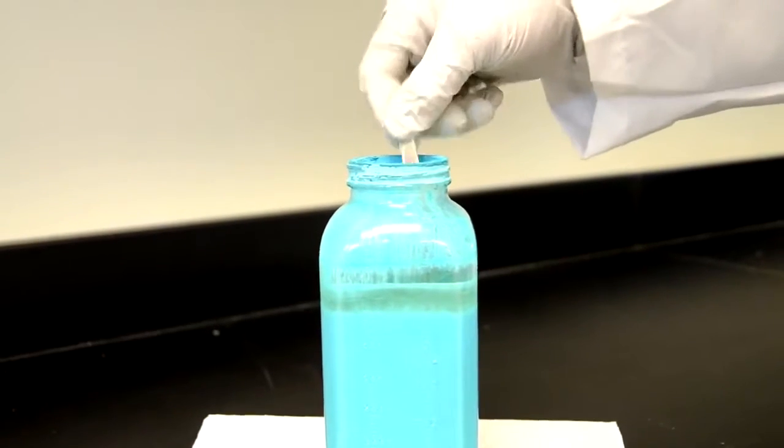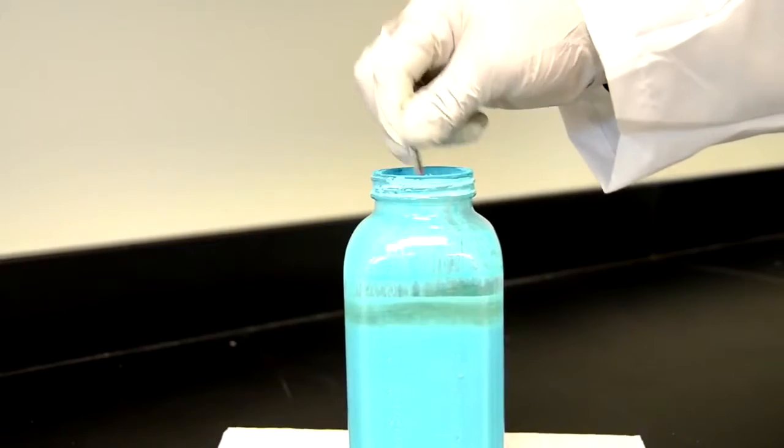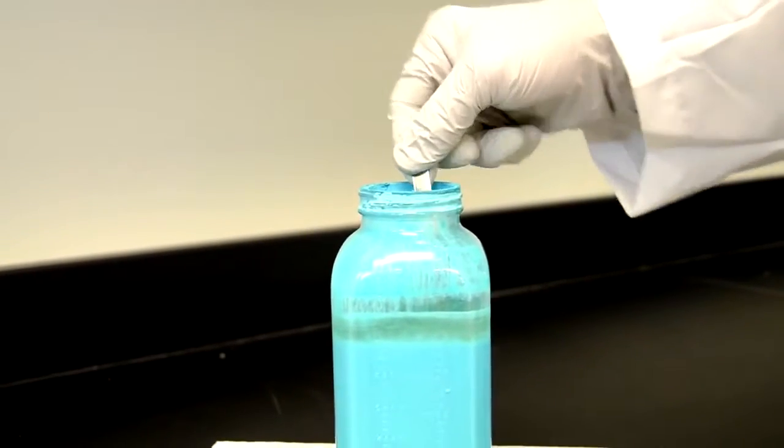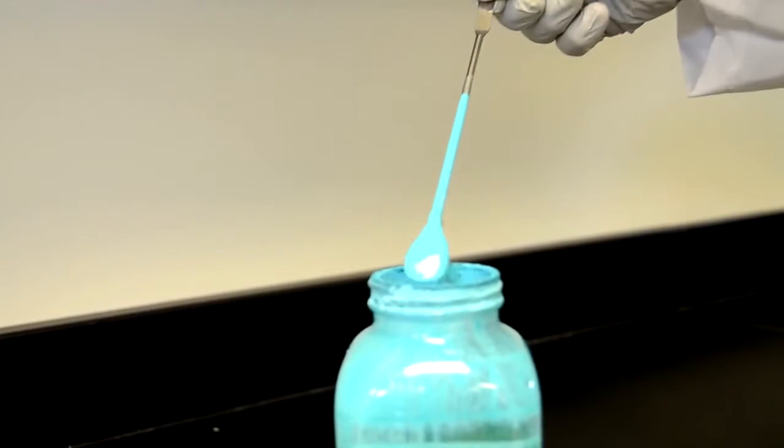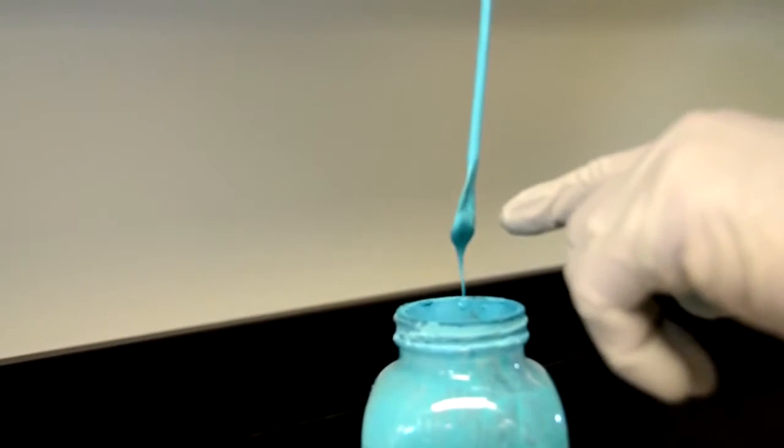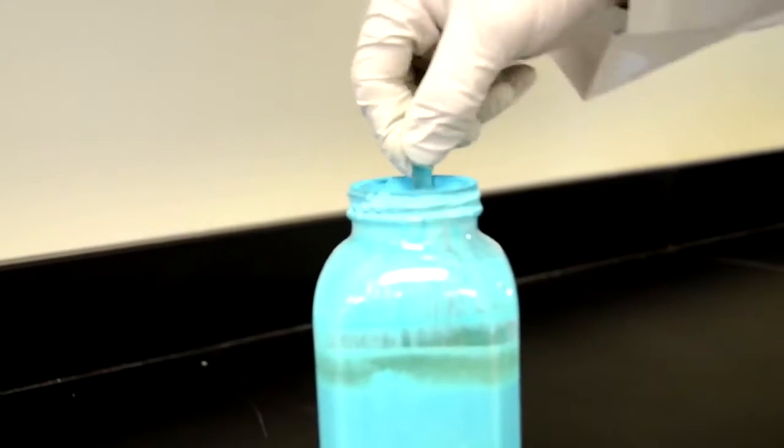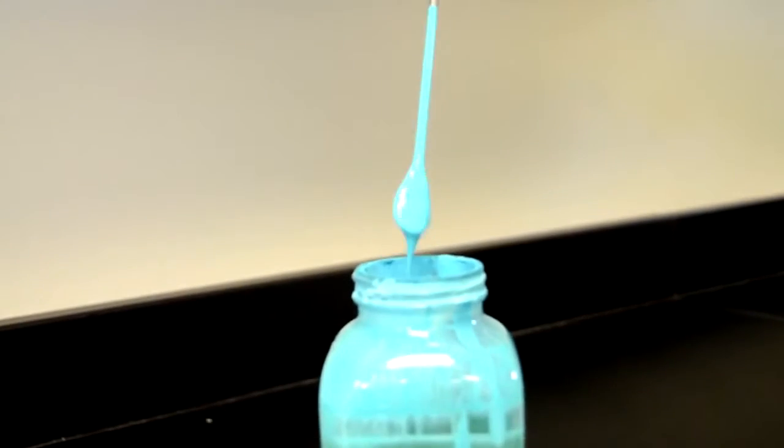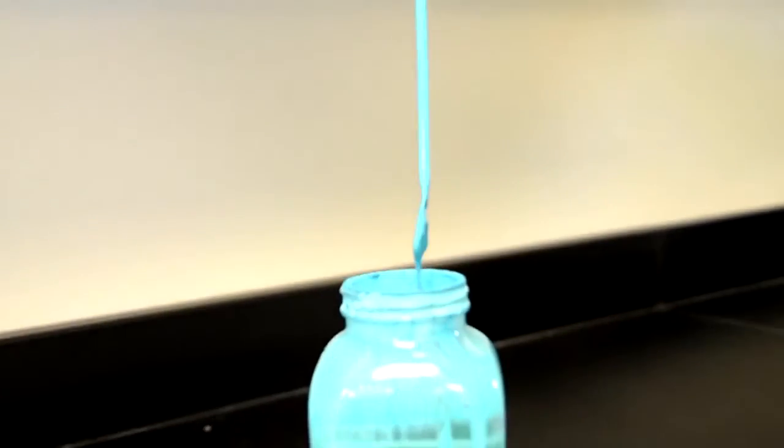So when you probe down you hear a little bit of a clink sound but it's very thick on the bottom. And if I go around you'll see a bulb or a type of chunk on here that's typical of sedimentation that's forming.